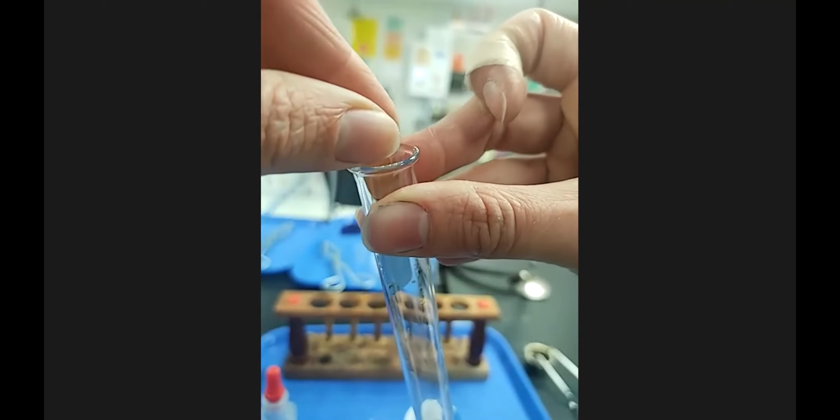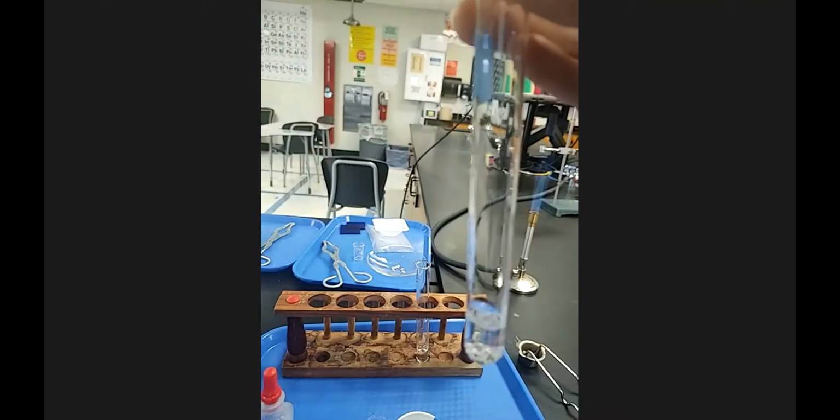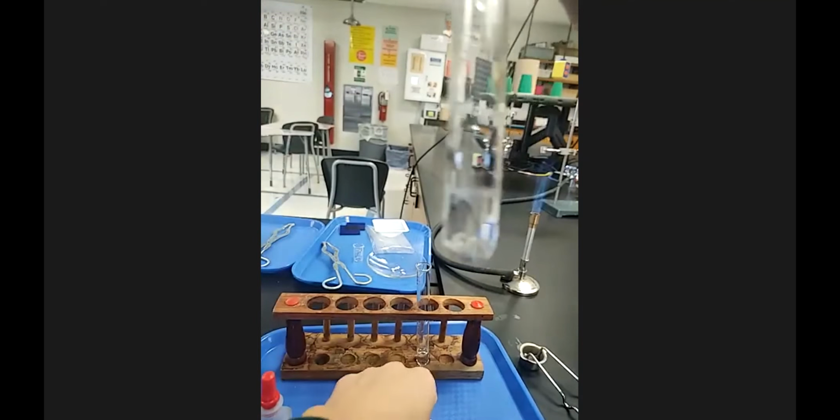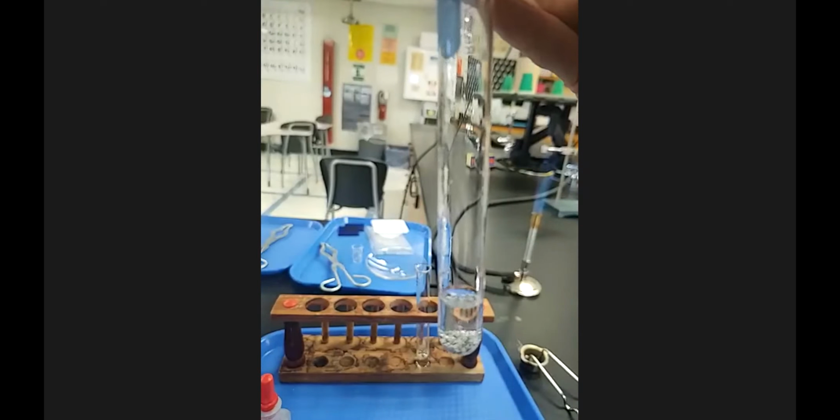Sometimes students take chemistry and they're like, oh, I can't touch anything with my hands. And it's like, well, you probably have some zinc metal around your house, and you can definitely touch that with your hands. So I'm gonna do the zinc one first, and we'll view that. I'm gonna add a little bit more of the zinc here.